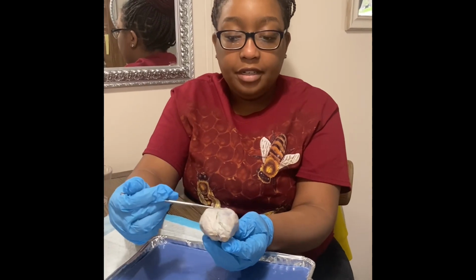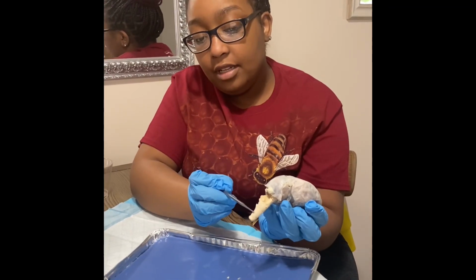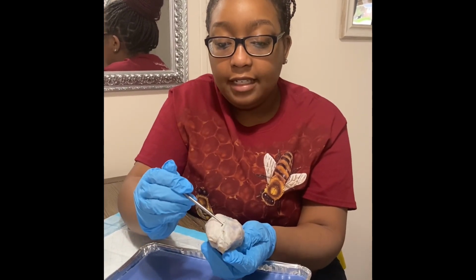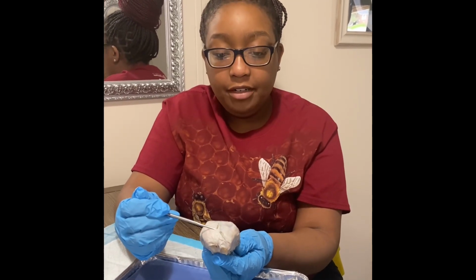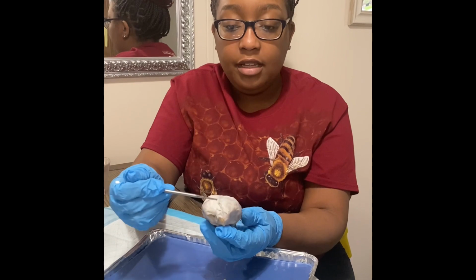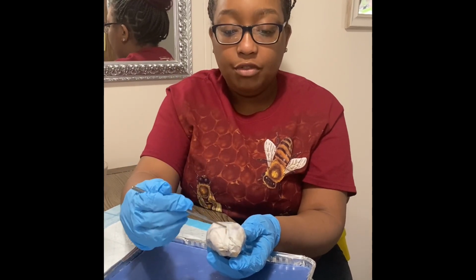This part right here is the cerebrum, and this part right here is the cerebellum, which is a small brain. Right here, this little thing is the spinal cord, and then you have this little thin layer of connective tissue. It consists of 3 layers: the pia mater, the arachnoid mater, and the dura mater. These layers are all called the cranial meninges. And once you do a sagittal mid-plane cut right here, you will see the longitudinal fissure.